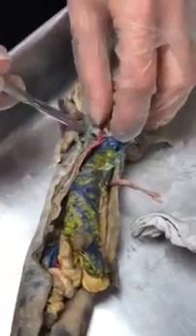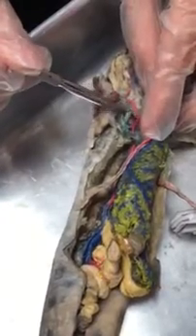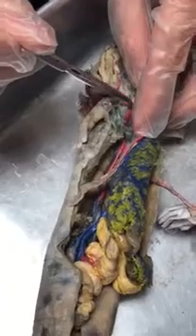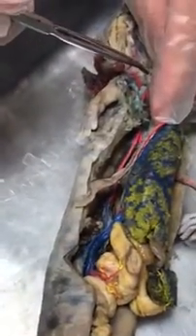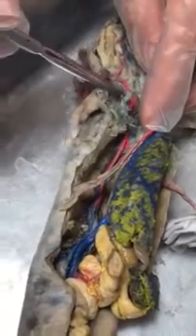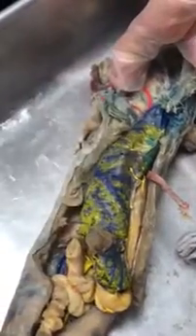Okay. And then from the gills, collecting into the dorsal aorta are the roots or the radices of the aorta. So right there, you can see it coming from the gills. Root or radice of the aorta, dorsal aorta. And then the branch that goes into the arm is the subclavian artery. It's pretty obvious.